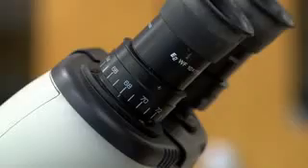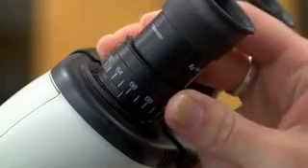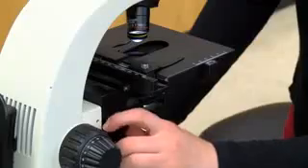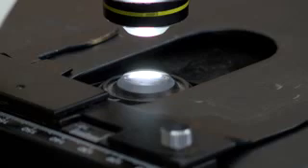The on-off switch is on the back of the scope and may be hard to find if the power cord is still wrapped around the holders. Check the ocular lenses and turn them until the number 64 lines up with the white line below the rotating part of the lens. Check that the condenser lens is just below the stage.